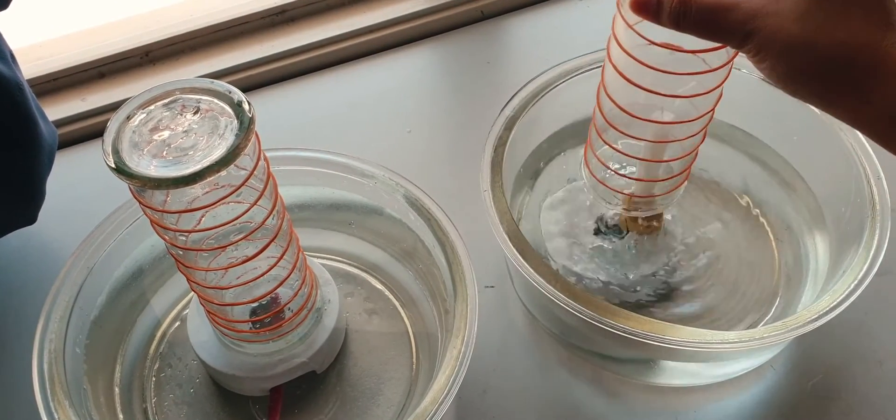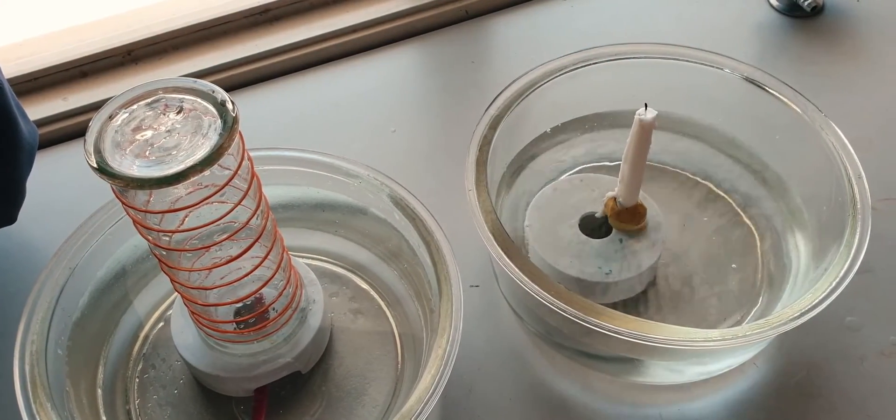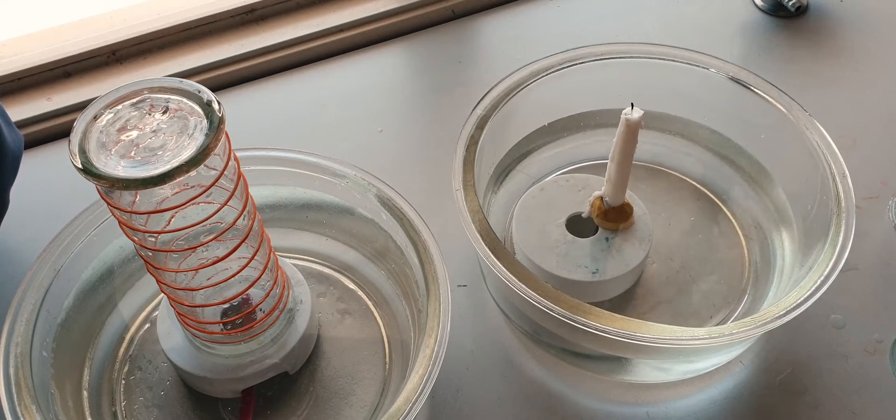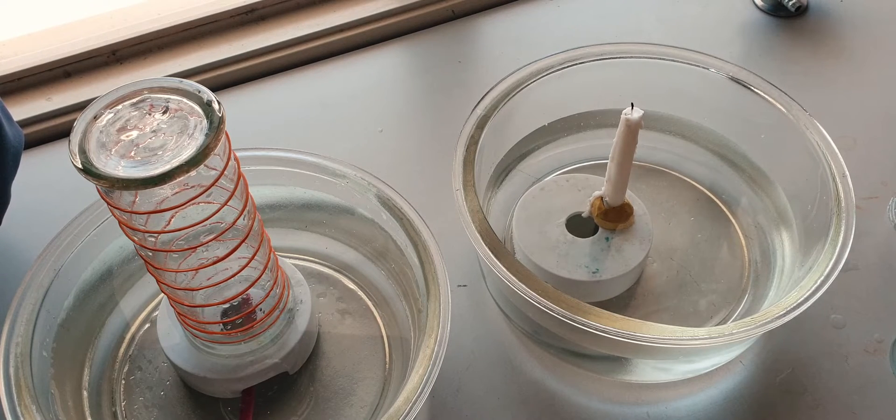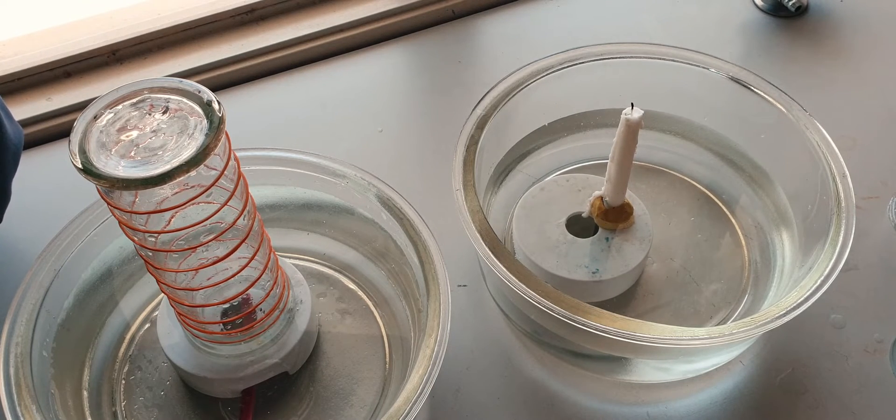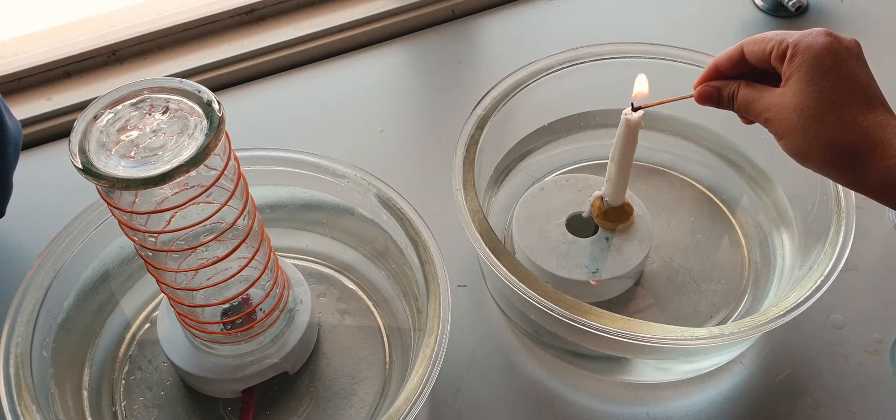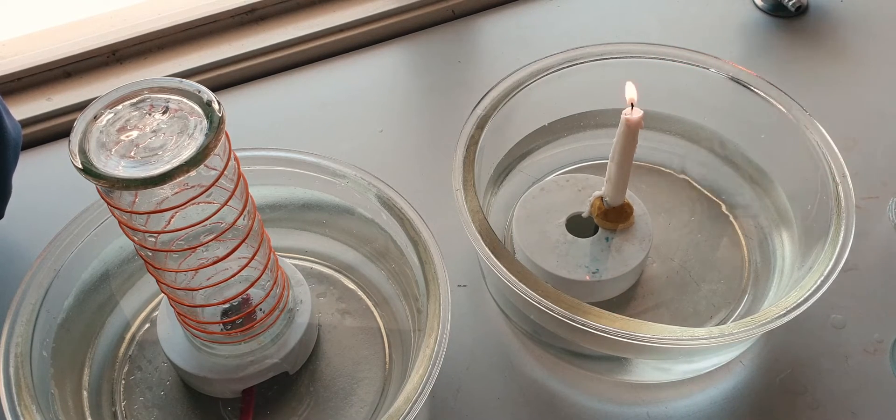That's it. So what I'm going to do now is I'm going to take this one out. I'm going to light up the candle again to test the oxygen level of the exhaled air.